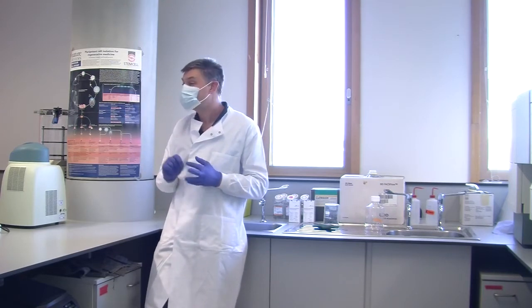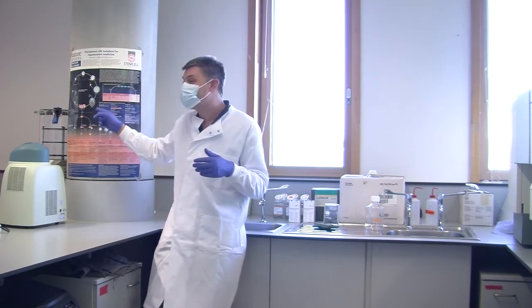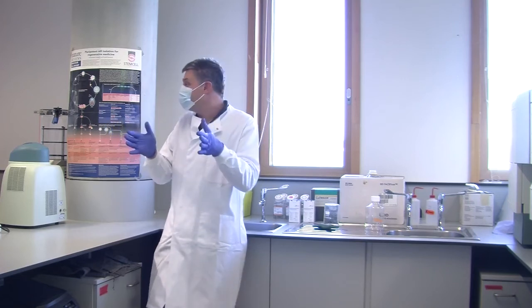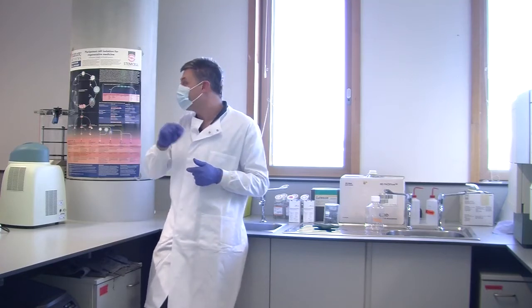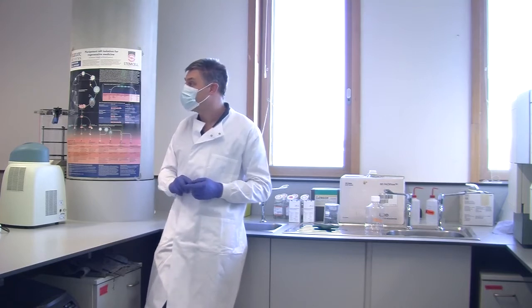Meanwhile, of course, the centrifuge is now not balanced. Now, if you don't balance this one, as you say, it jumps around and shudders. This centrifuge, without its missing bucket, because it was spinning so fast, leapt around the room, destroyed just about every other instrument in there, and destroyed itself. And it did about £3 million worth of damage to the instrumentation in there.